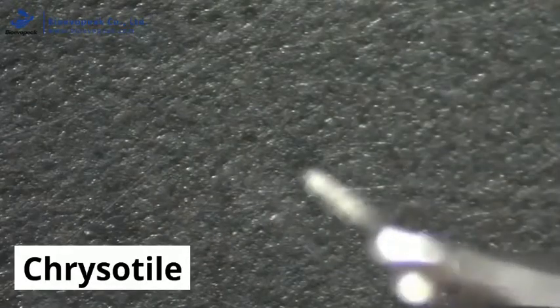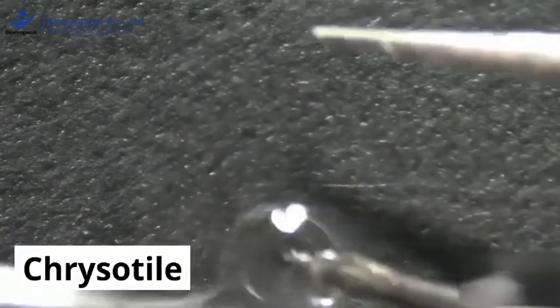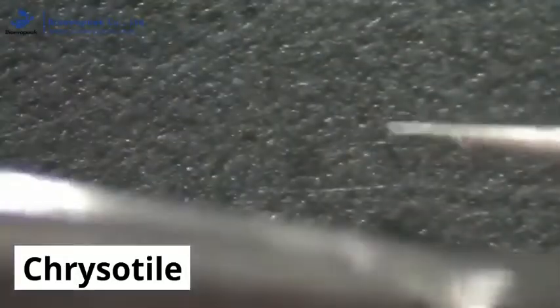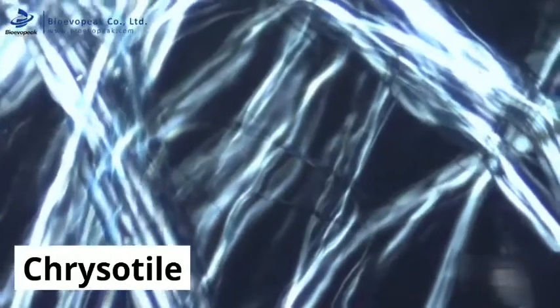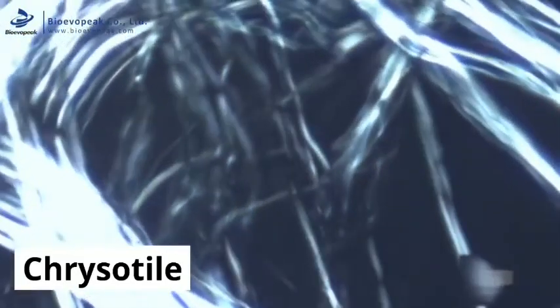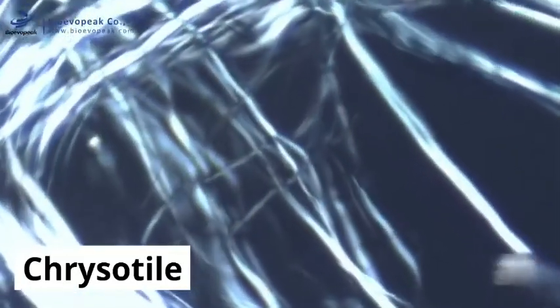The slide is placed under the polarised light microscope and the optical properties assessed. As with amosite, chrysotile shows little colour change under plain polarised light, and also shows little to no relief. This means that the fibres seem almost invisible at this stage. Next is the birefringence and extinction. The fibres again appear and disappear, indicating a mineral, but the fibres don't glow quite as brightly as the amosite fibres did.